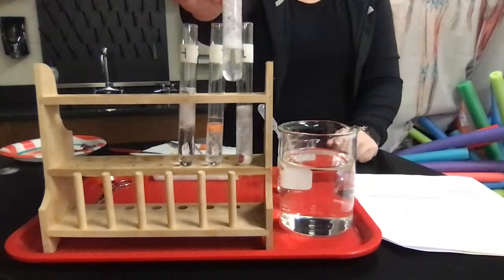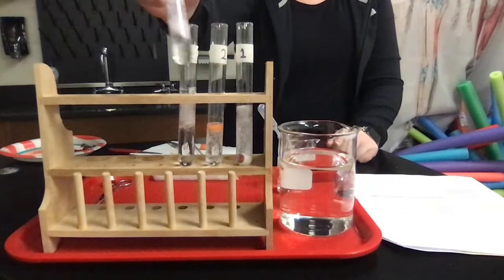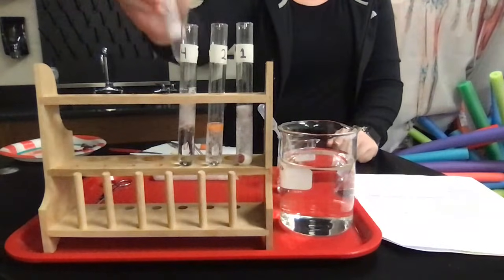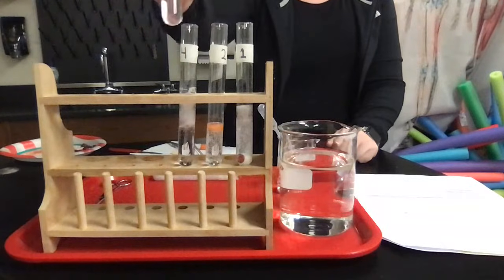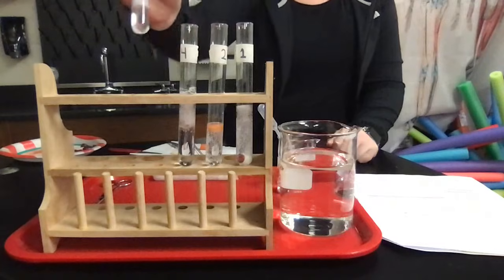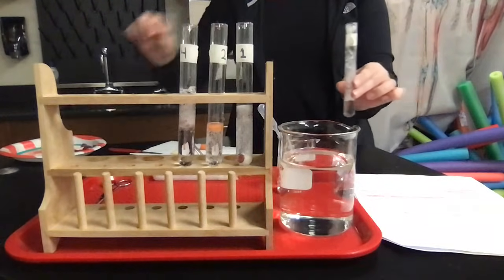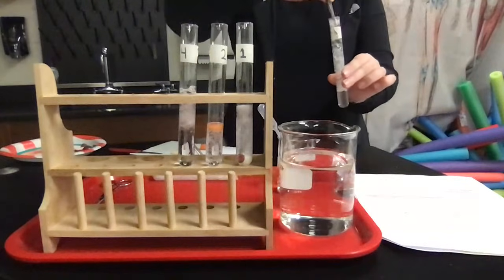The next thing you're going to see is if the liquid that I just poured off is, quote, reusable. Theoretically, this is the supernatant that I poured off after the reaction had happened. This should be water because the catalase should have broken down all the hydrogen peroxide. So I'm going to add a fresh piece of liver to this test tube, which should be water.